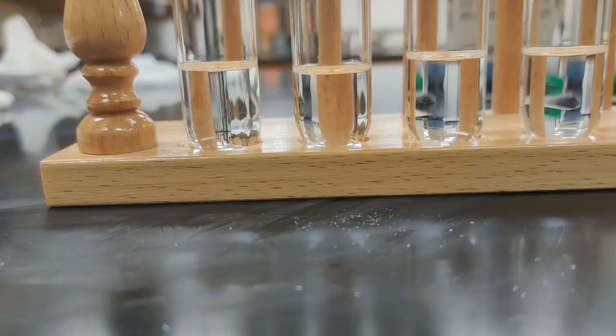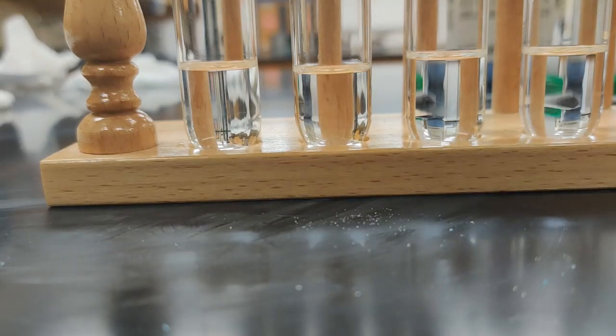So now we're going to run these same samples through ethanol to decide whether we find that these things are soluble in ethanol. Ethanol on one end is kind of very similar to water, but the other side of ethanol is all C's and H's. So we're going to start with iodine.